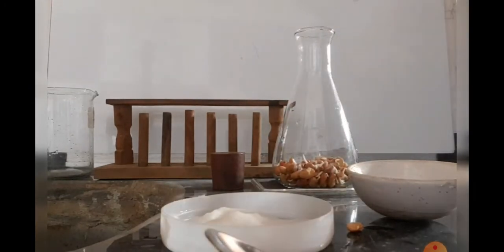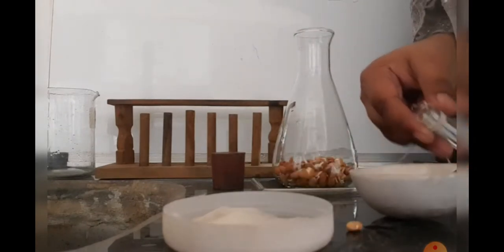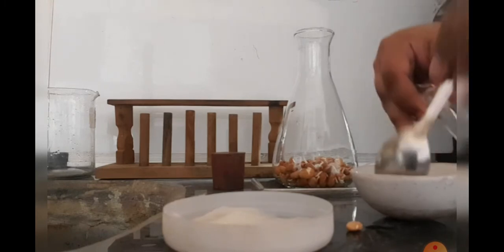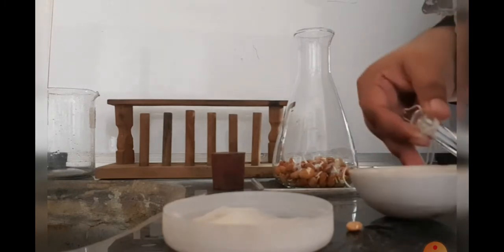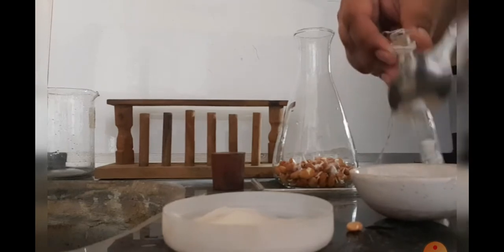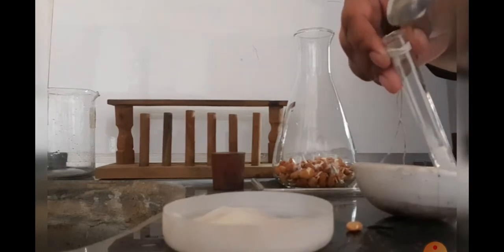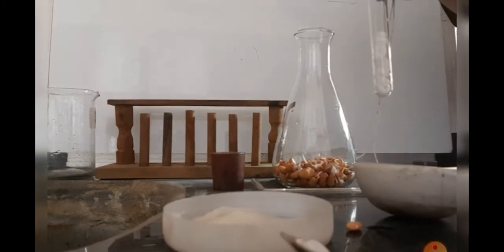We need to take potassium hydroxide pellets in a test tube. We can even use an aqueous solution of potassium hydroxide. After taking the potassium hydroxide pellets in the test tube, we have to place this test tube inside the conical flask.